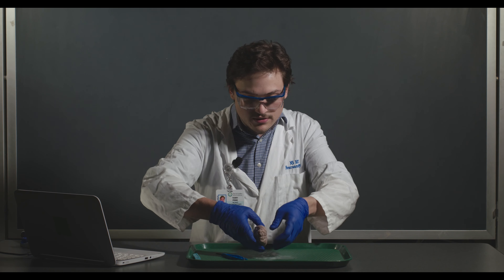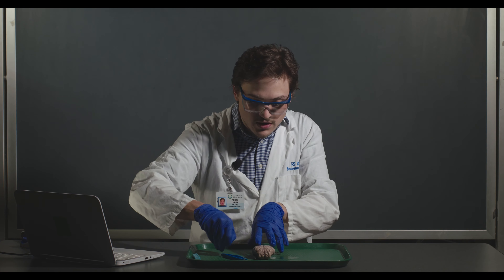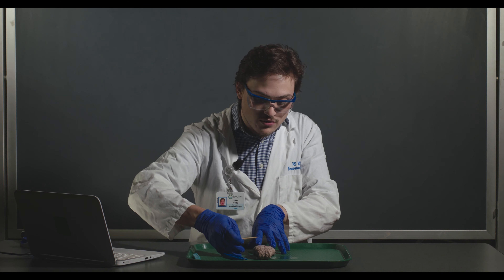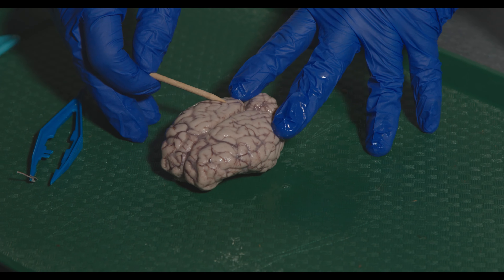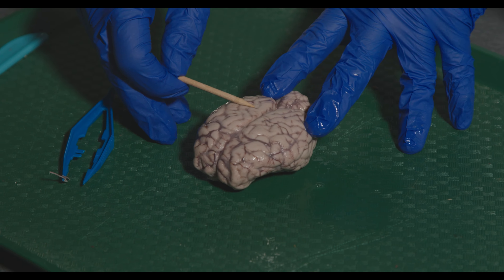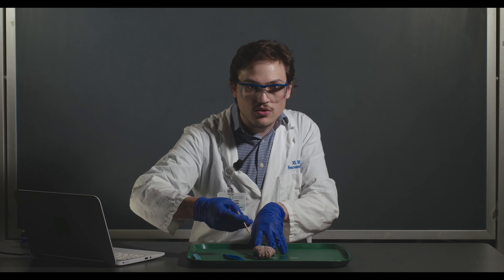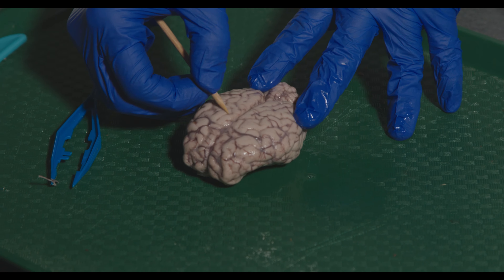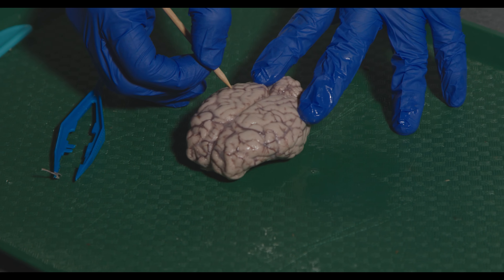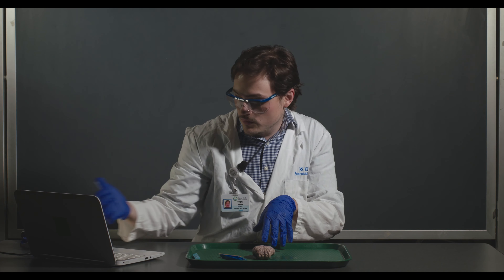Some other things we can see on the exterior are the gyri and sulci. Gyri — or gyrus in the singular — are these bumps, the hills in the brain. Sulci — or sulcus in the singular — are the grooves in the brain. We can see both of those on the surface.